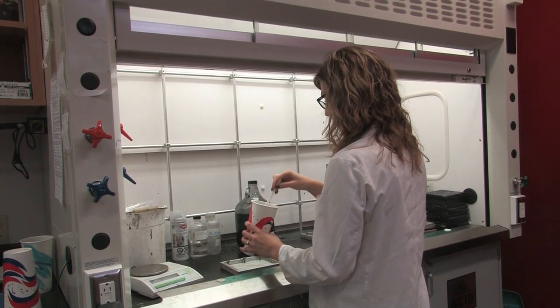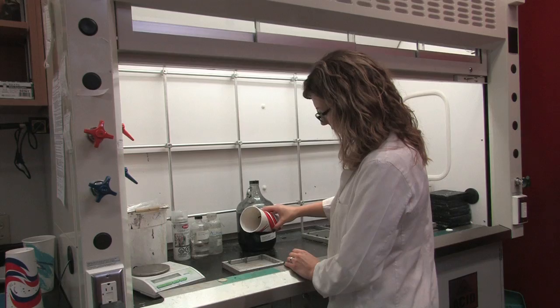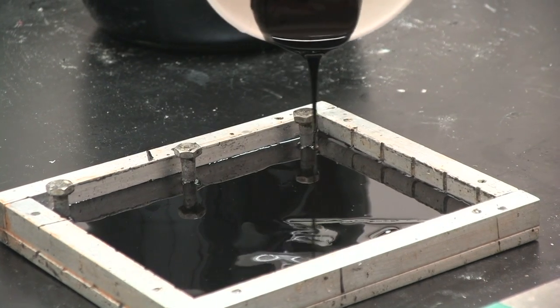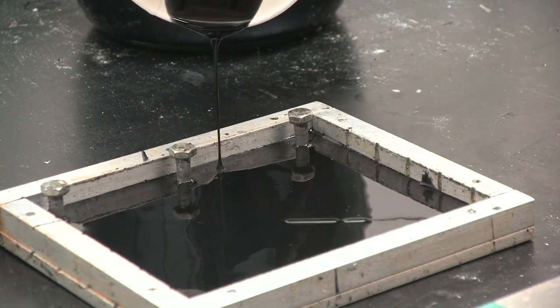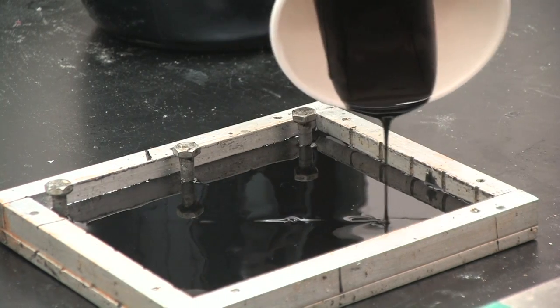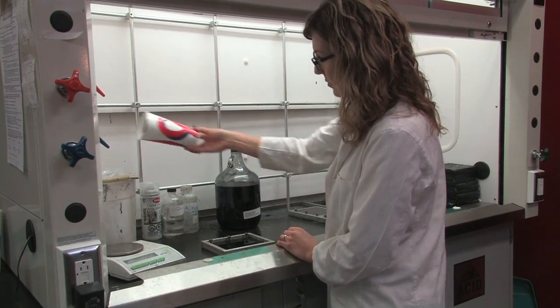Use a spoon to mix the epoxy and hardener and then gently pour enough of the mixture into the tray to cover the spaghetti strand and fill the corners. Be sure to put all resin coated garbage in the garbage bin in the fume hood as well.